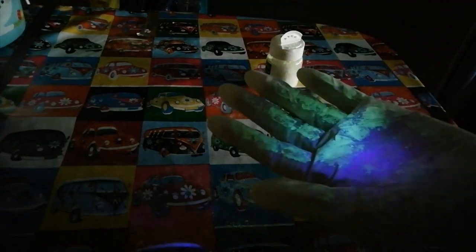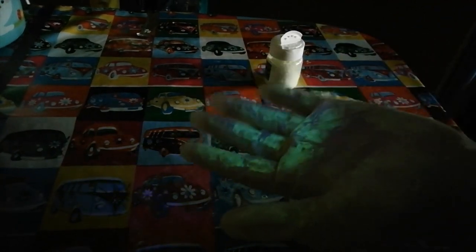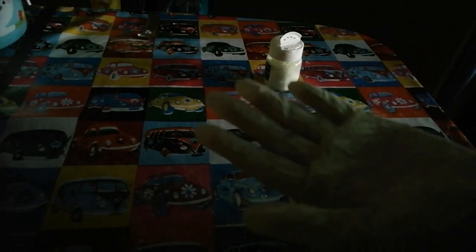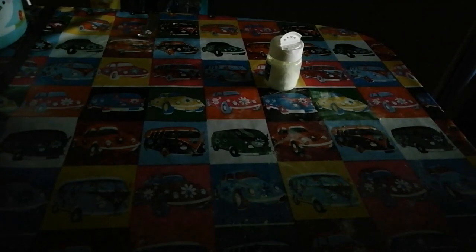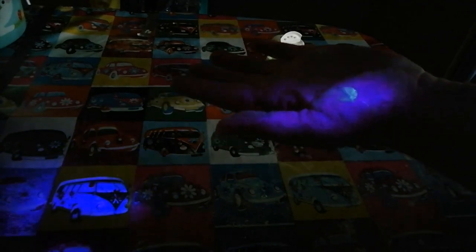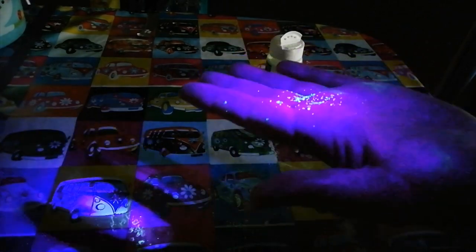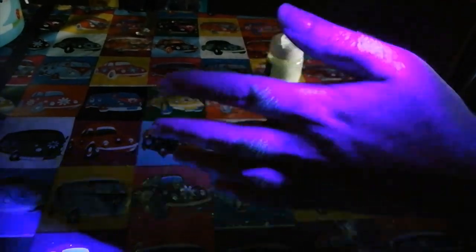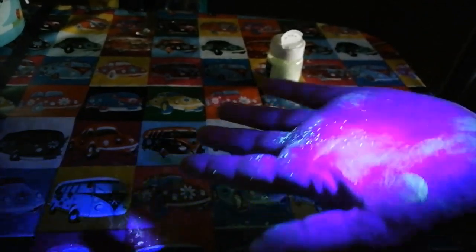If you're working under such conditions, the contamination is not on my actual skin — it's just on the protective glove. Now let's remove the glove. So how well has the glove protected me from the contamination? Not 100%, because of my sloppy glove removal technique. You can see the simulant lighting up on my hands. Although I was wearing a glove and my hand was clean before, sloppy glove removal means I might as well have not been wearing a glove in the first place.